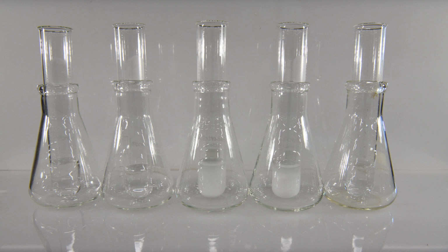Here's a view of all 5 of the reactions with sodium carbonate. The bubbles in the first, second, and last test tube have pretty much dissipated, but you saw in the video what happened there. And the precipitates in the third and fourth test tubes are still quite obvious.